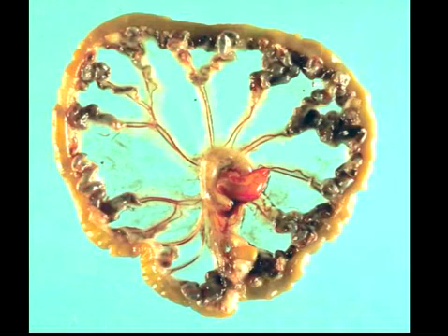The distribution is multifocal coalescing. And if you look at these histologically, you will see that there is extensive necrosis. The walls of these tortuous arterioles are infiltrated with large numbers of neutrophils. There is segmental stripping of the endothelium and extrusion of fibrin and other proteins into the intima and superficial media of these lesions, giving the classic lesion of fibrinoid necrosis. I don't particularly like the term fibrinoid necrosis, but that's where I get necrotizing.